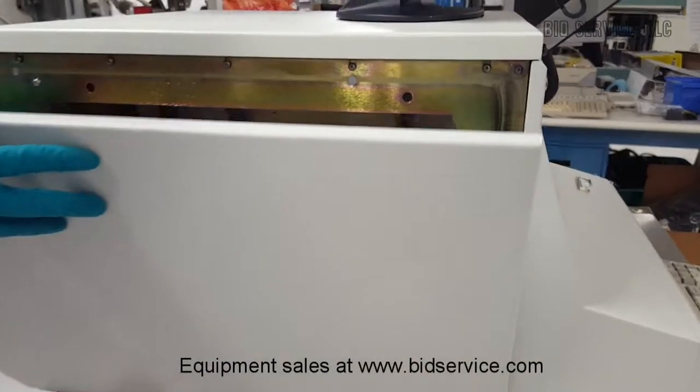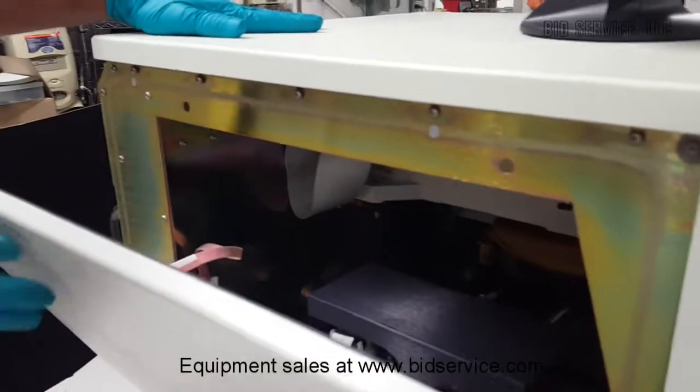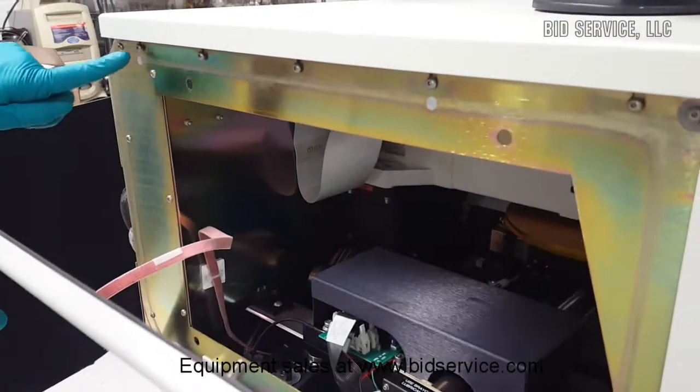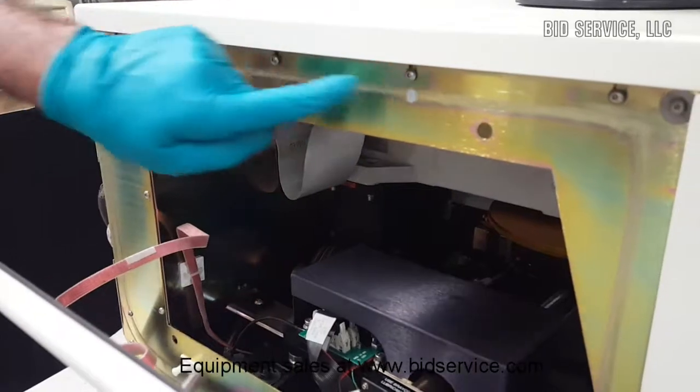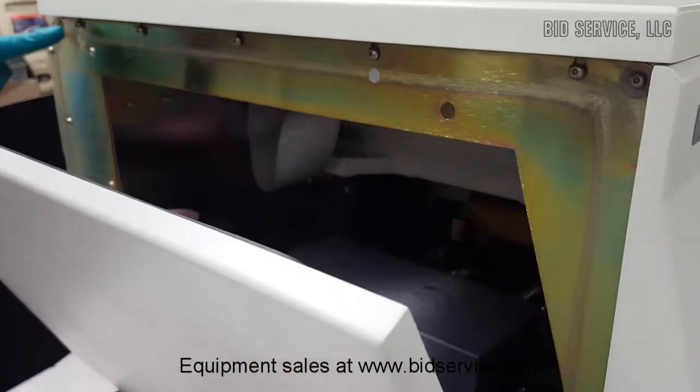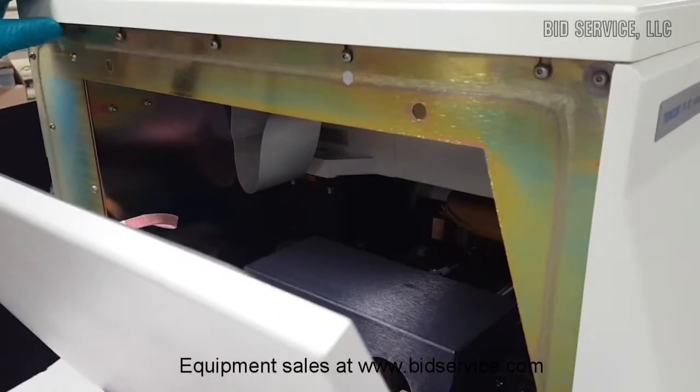So if necessary, the top lid is to be opened for any kind of assessment. There are screws here on both sides. First open the side covers and loosen these screws. This top lid comes off.